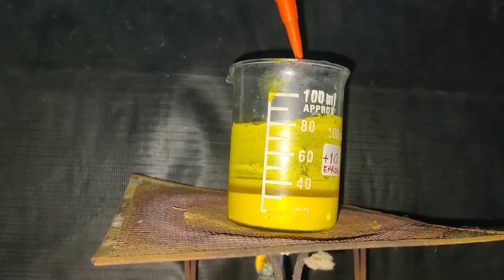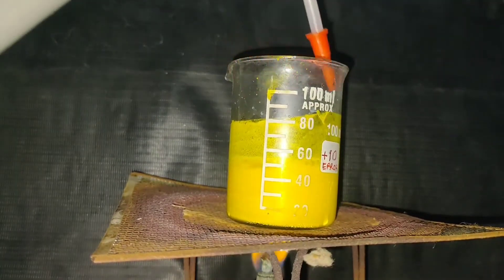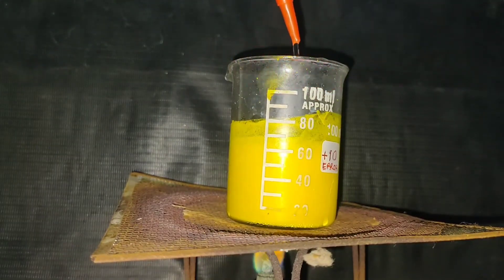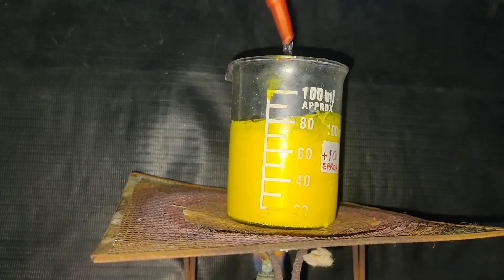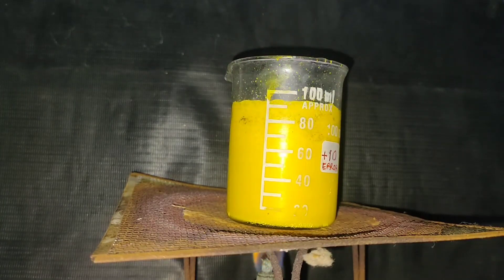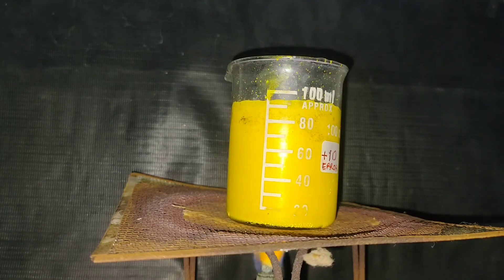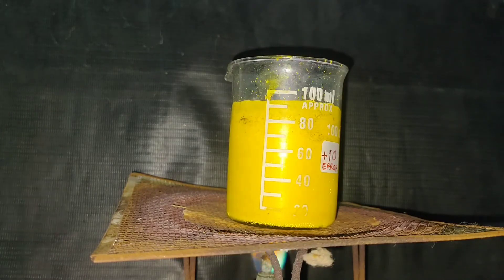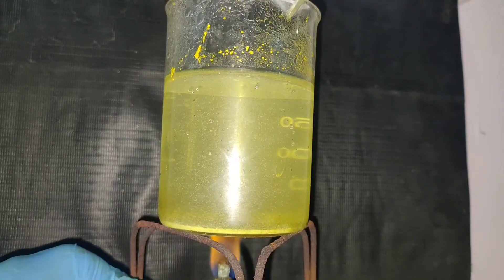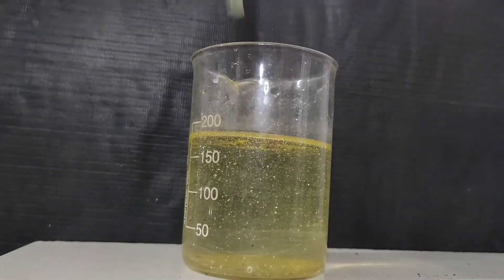The precipitate is boiled with distilled water. Lead iodide is soluble in hot water, so I am dissolving it. When the content did not dissolve, I increased the volume and transferred the content into a large beaker.